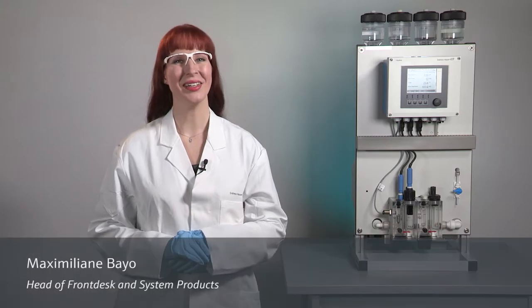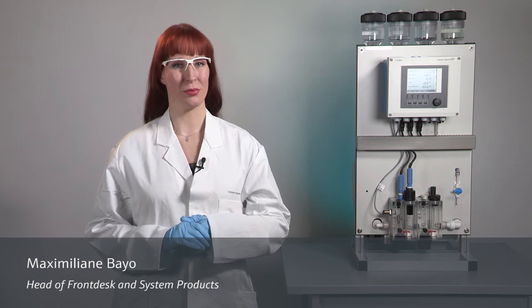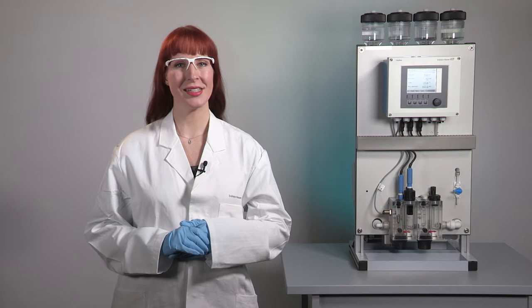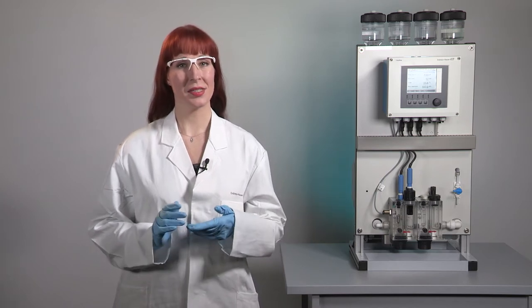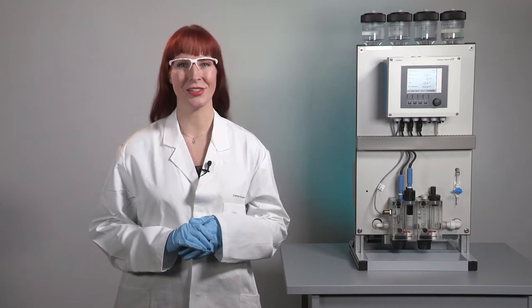Hi, I'm Maxi Bayo and together with my team I will show you how to carry out the calibration of our Chlorine Dioxide sensor MemoSense CCS50D. With this digital sensor you can reliably measure Chlorine Dioxide in different water applications.